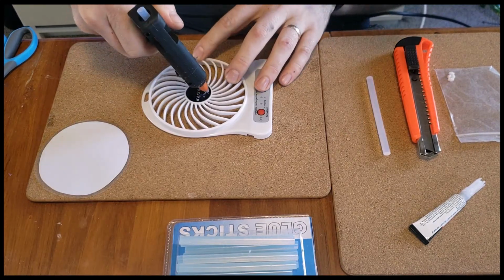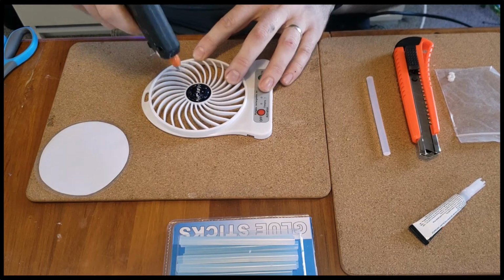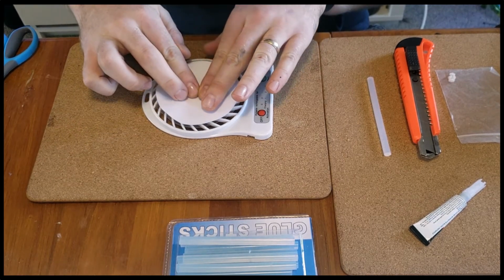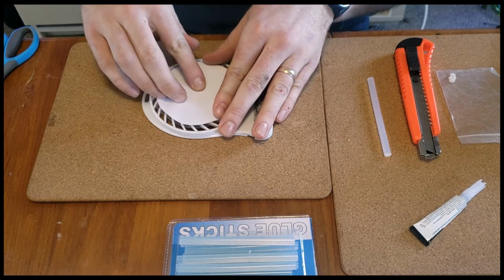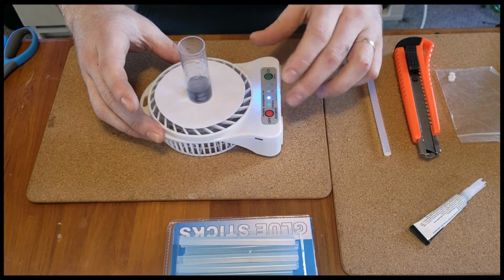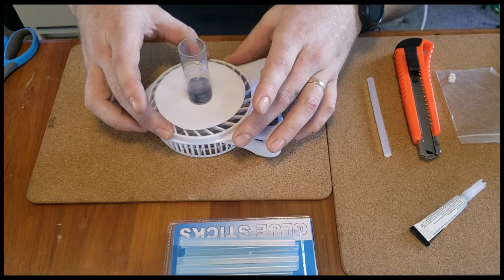Now that I'm happy, it's time to glue on the plastic membrane, and I'm just using a little bit of hot glue. The reason we're using white is because most titration test kits are color change based, and we want to be able to easily diagnose the change of color. Finally, again, it's time for a quick test, and once you're happy with it, it's time to flick it over and screw it in.